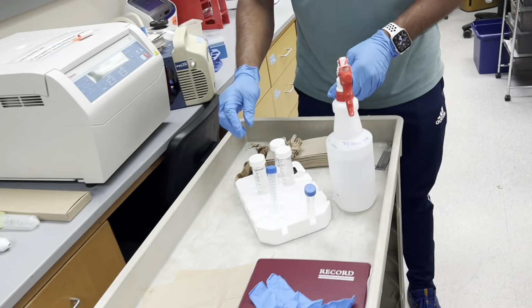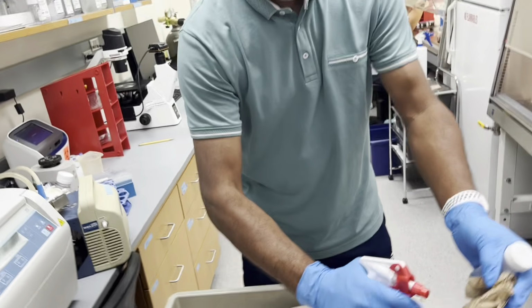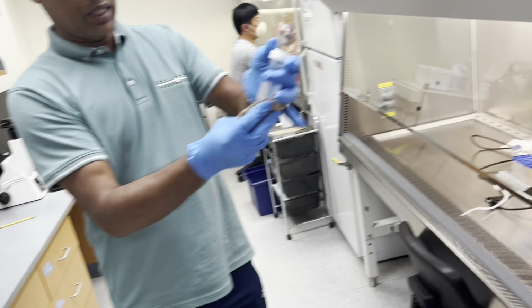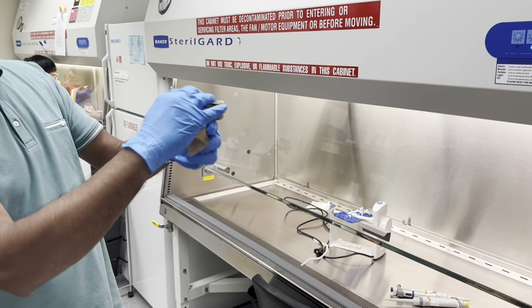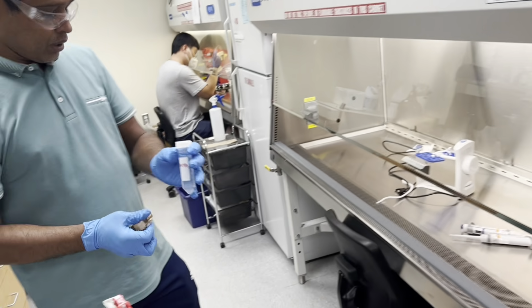Okay. Now I'm going to do this also, but make sure that you are not erasing your labels.